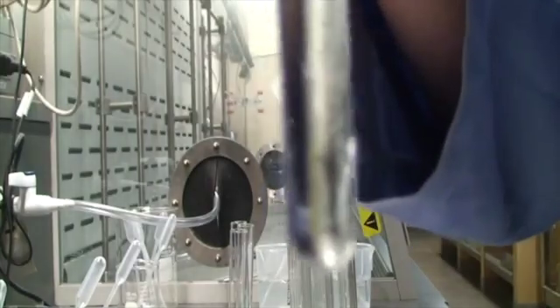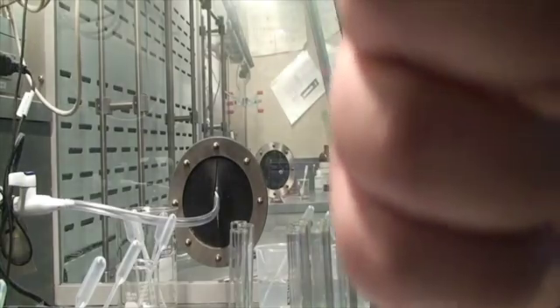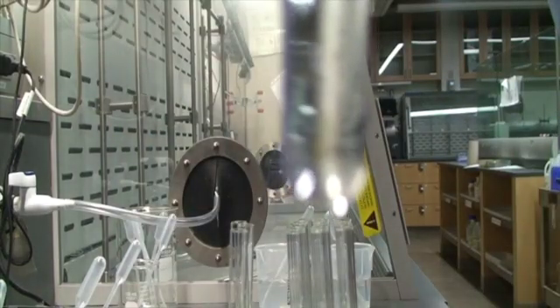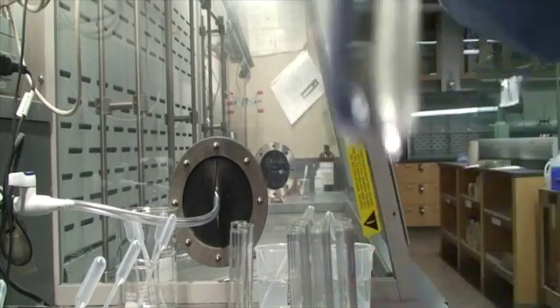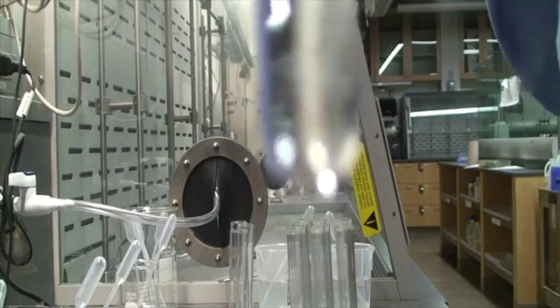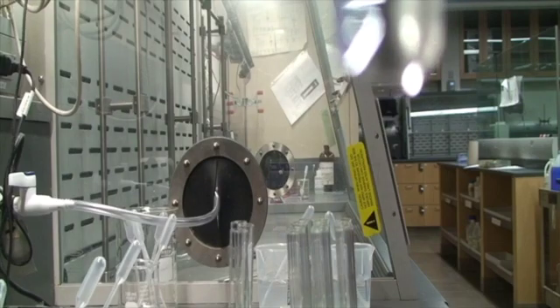Here's 1, and here's 2. Alright, so let's check. I don't see a precipitate there. The test tube doesn't feel warm. Don't see any bubbling. Let's do our smell test. Let's put the wooden applicator stick in there. Nope, don't smell anything. Alright, so it looks like 8 plus 9 gives you no reaction.